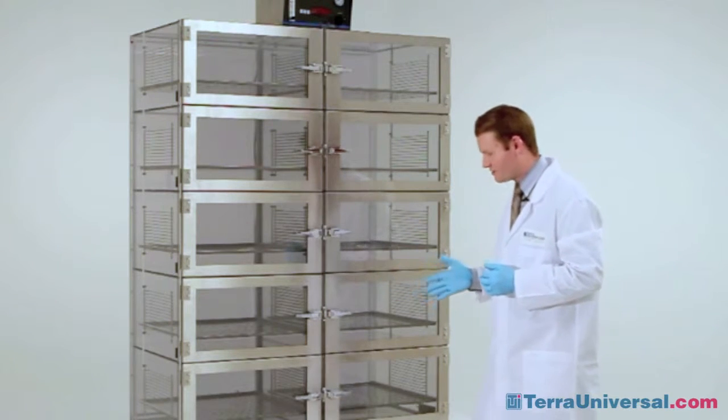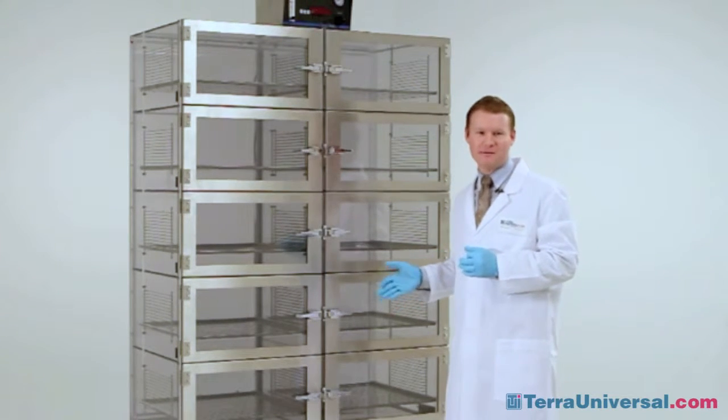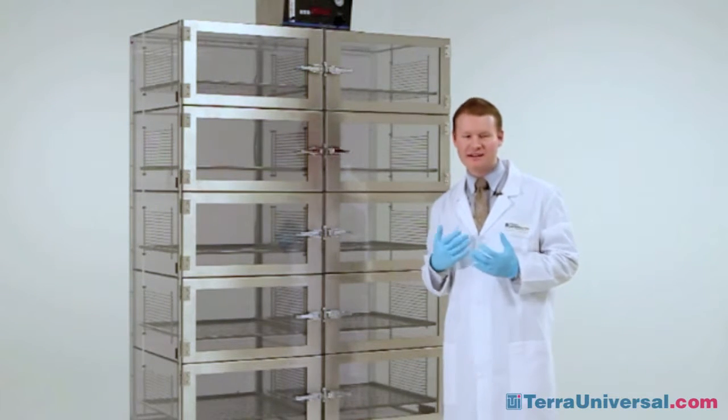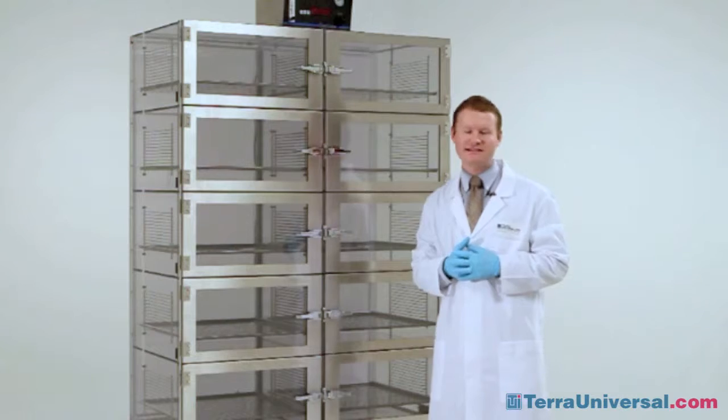Now we've placed the desiccator unit on a pedestal for demonstration purposes. Your desiccator is probably placed on a Terra Universal stand, maybe with casters for easy positioning.